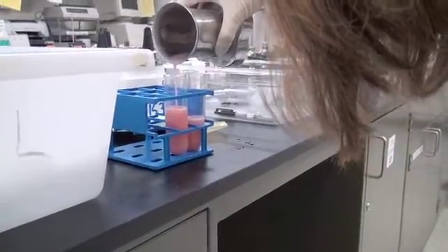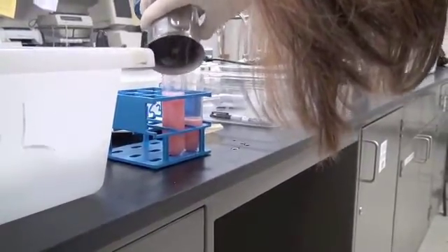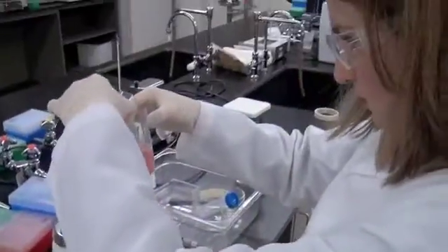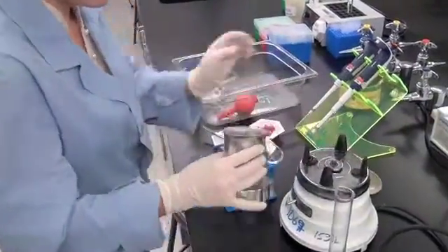Oh, it looks like a delicious strawberry smoothie. Ew, what was that? That, my dear, was probably the fat, connective tissue, and incompletely blended pieces of meat, all due to her poor sample preparation.